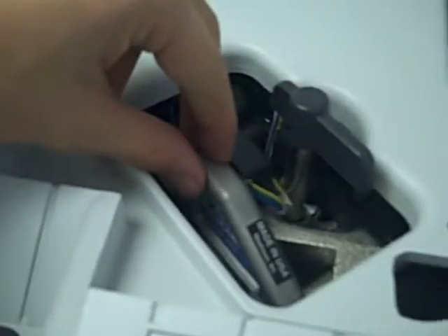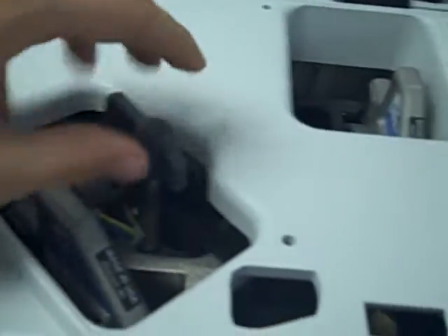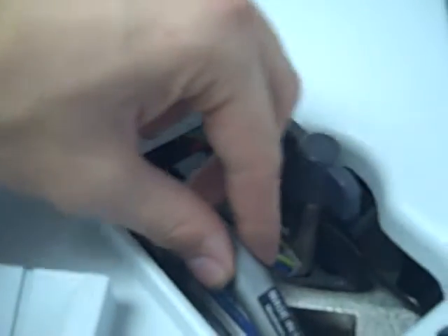You grab the next one you are going to be using and drop it right into place slowly. There is going to be a little wiggle room right here — that is good. Then you turn the knob and the clamp will grip onto your beam splitter, and there will be no wiggle room next.